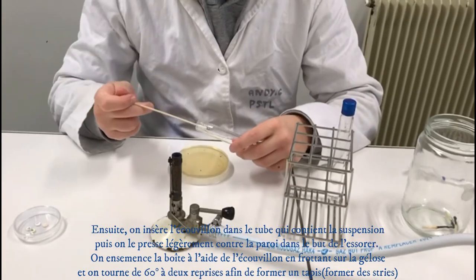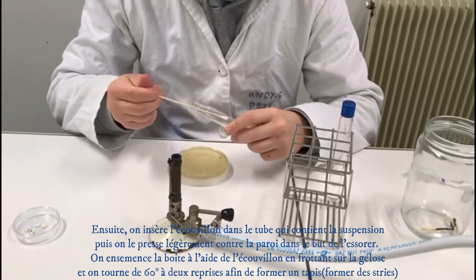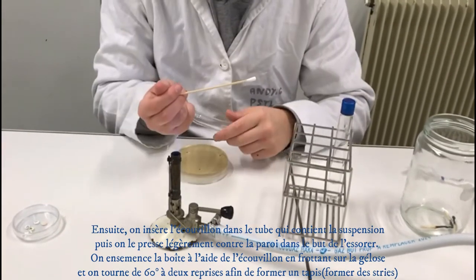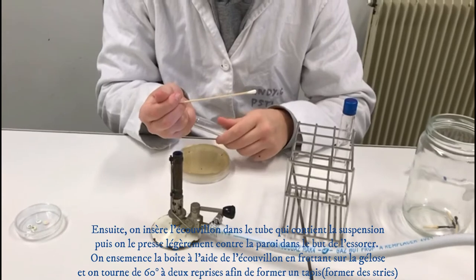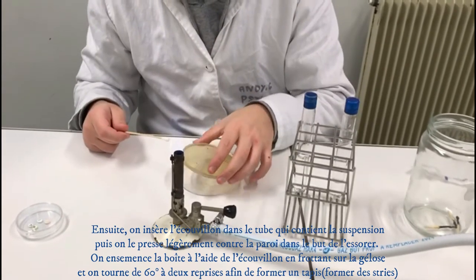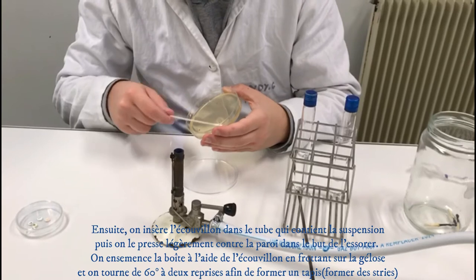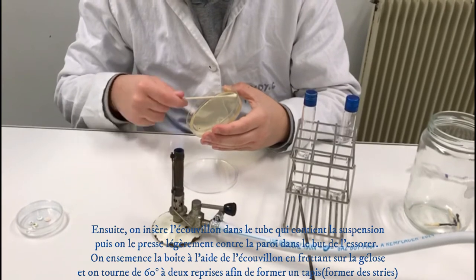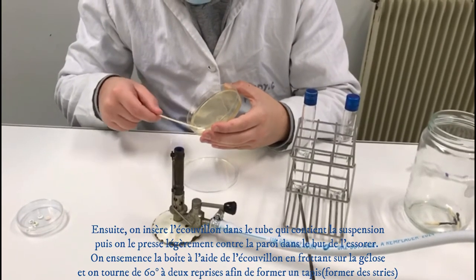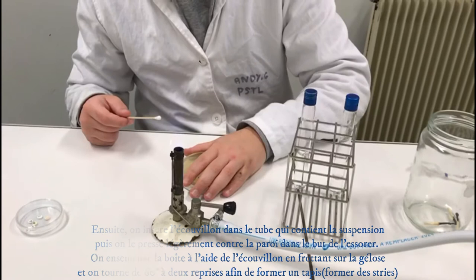For the second task, insert the swab into the tube and wring it out lightly. Seed the petri dish with the swab by rotating. Turn the petri dish 60 degrees to make an even mat.